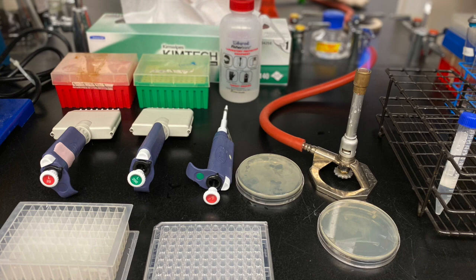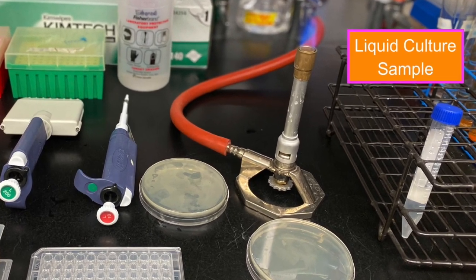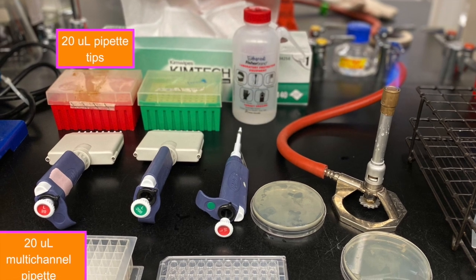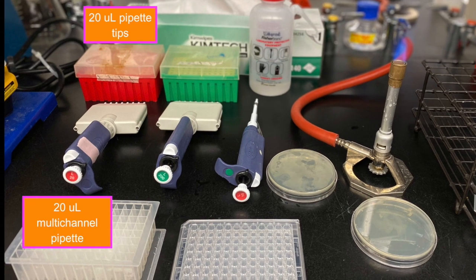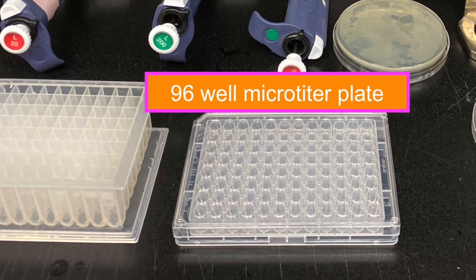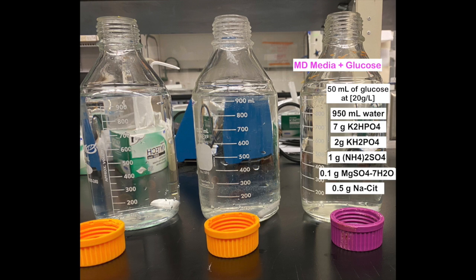In order to make a spot plate, we are going to need a liquid culture sample from the chemostat, a 200 microliter multi-channel pipette and tips colored green, a 20 microliter multi-channel pipette and corresponding tips, which are colored red, a deep well, a 96 well microtiter plate, and 2 agar plates with 2 strips of parafilm. And lastly, a couple milliliters of sterilized MD media spiked with glucose.